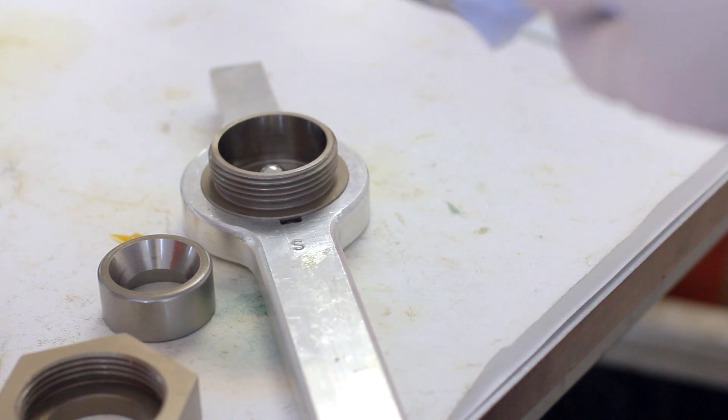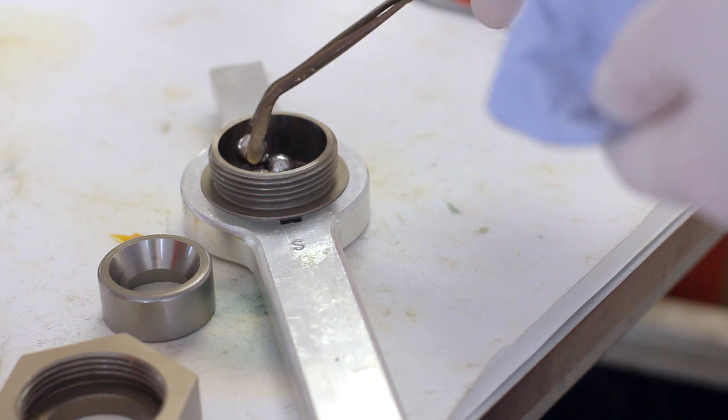Now let's do the same test with the Rocol food lube universal grease with the same load and the same speed.